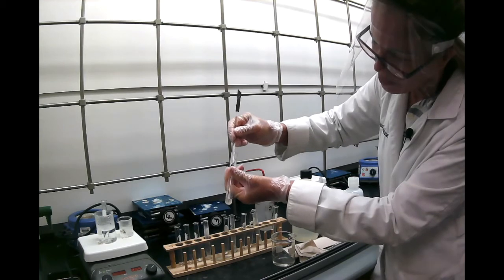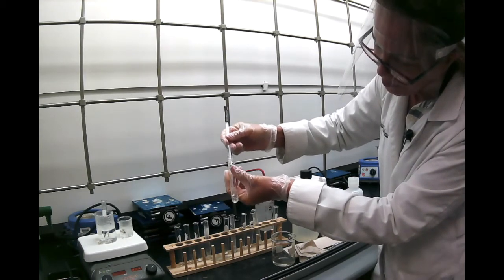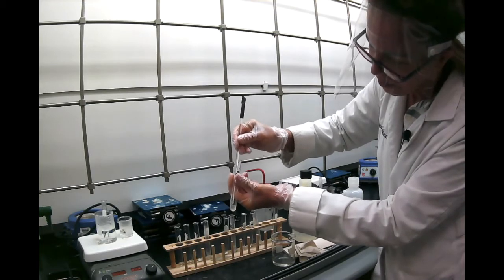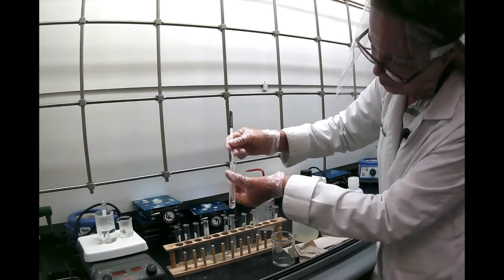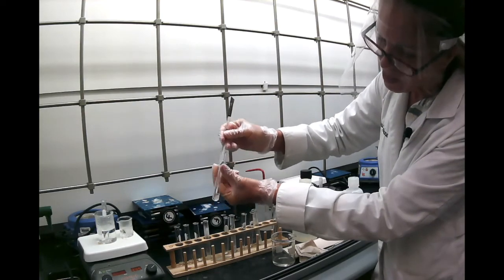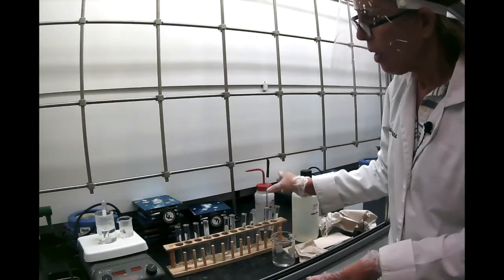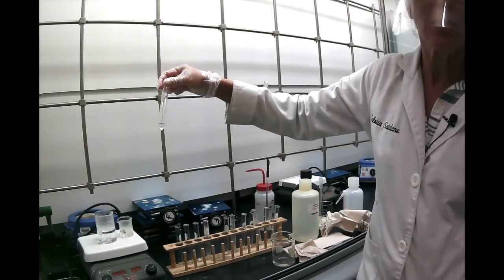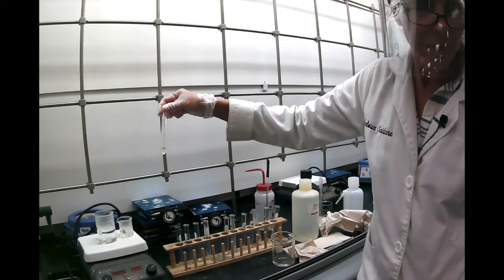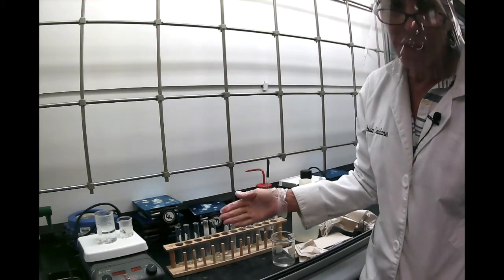It looks like it's dissolving. So acetanilide dissolves in alcohol. And then we're going to go back to the naphthalene, and you see it is soluble in hot ethanol.